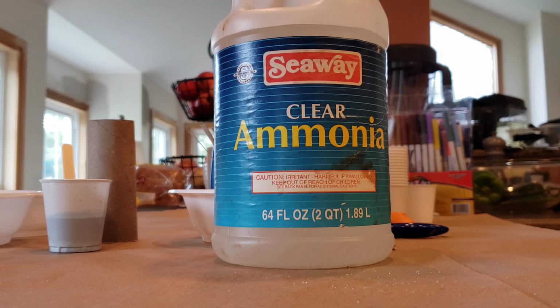You would be wearing safety goggles at school, and this is something that you would want to waft because it has a very, very strong odor, and a lot of people think it smells like urine, especially cat urine, because ammonia is in urine. When we've done this in school in the past, people are like, oh, that stinks. So you definitely do not want to stick your nose right over it, which you shouldn't be doing anyway if you don't know what you're working with.